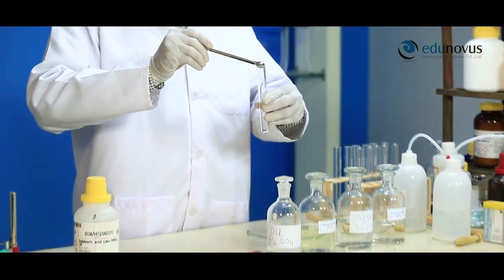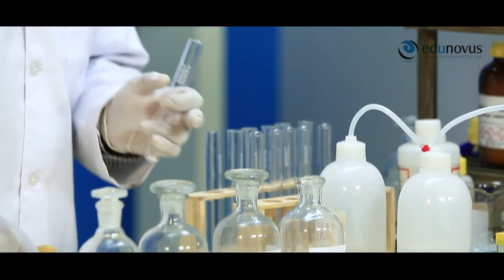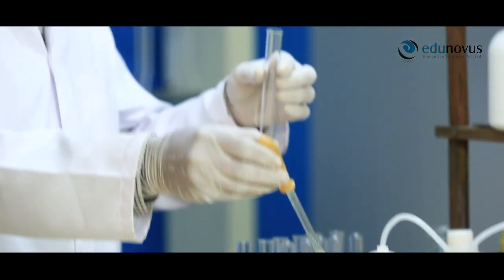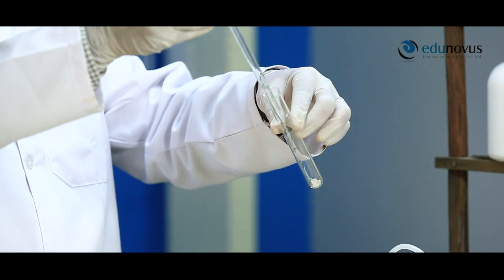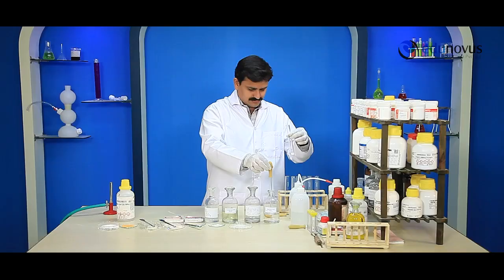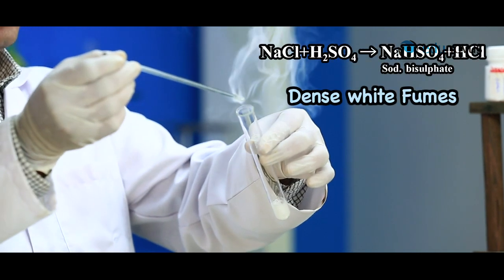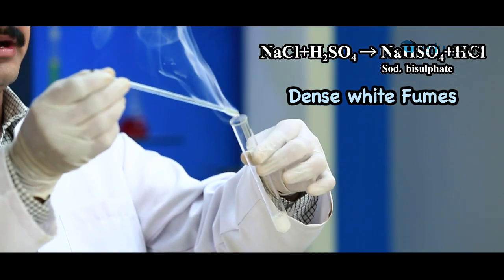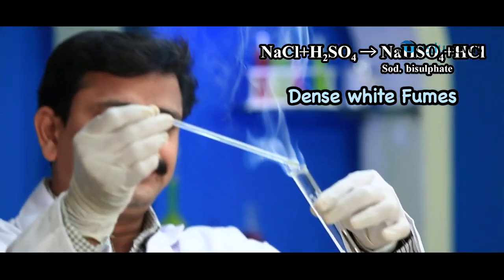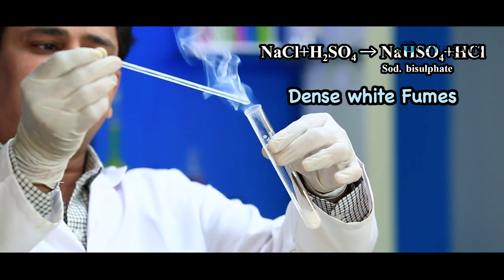Take a pinch of salt in a dry test tube and add 1 or 2 ml of concentrated sulfuric acid to the salt. If it gives dense white fumes with a glass rod dipped in ammonia, it indicates the presence of chloride radical. Here, you can see the formation of dense white fumes with the glass rod dipped in ammonia. This indicates the presence of chloride ion.